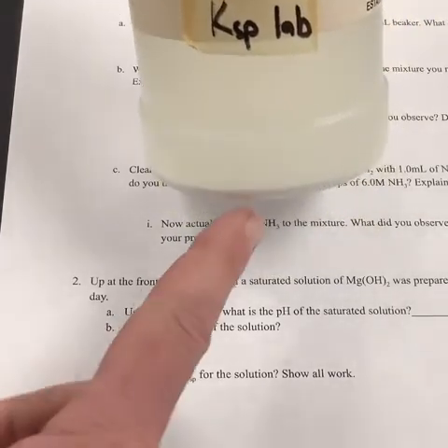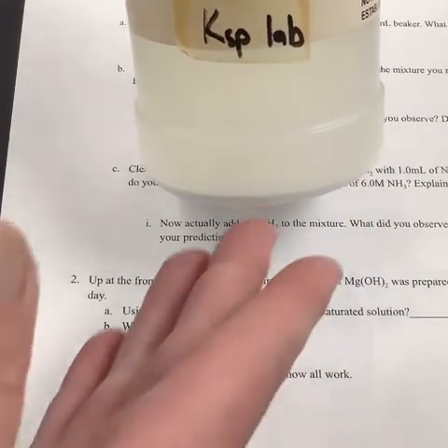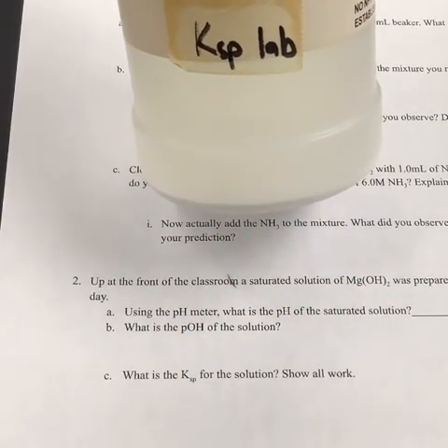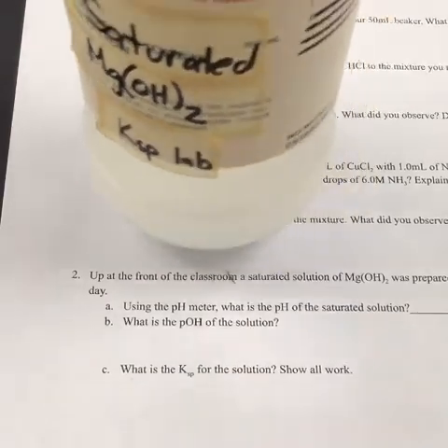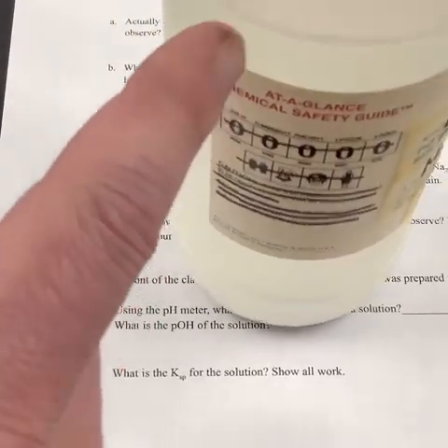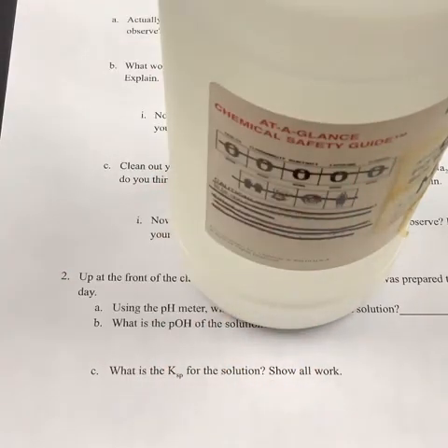We can tell that it's saturated because I formed a precipitate, and that precipitate has sank to the bottom, and I have actually let it sit for several nights. So the liquid on top of it here is as dissolved as it can possibly get. Most of it is remaining as a solid down below, but there are going to be a few ions up in this solution. So what I'm going to do is very carefully pour off some of the liquid up on top here. We can see there's a little bit of liquid up here. We're going to pour this off into a beaker so that we don't get any of the solid, just the liquid off the top. And we're going to take the pH of it.